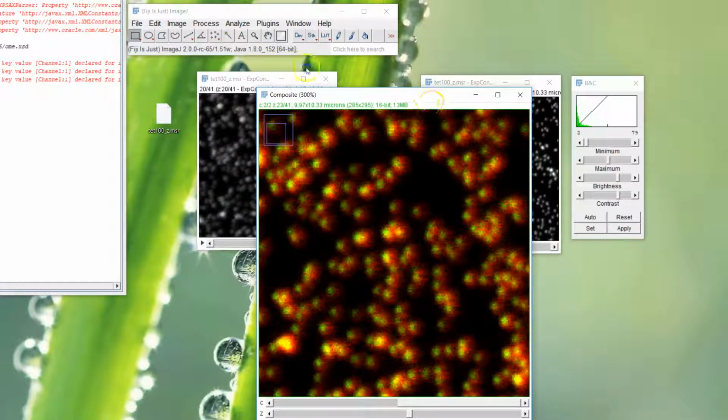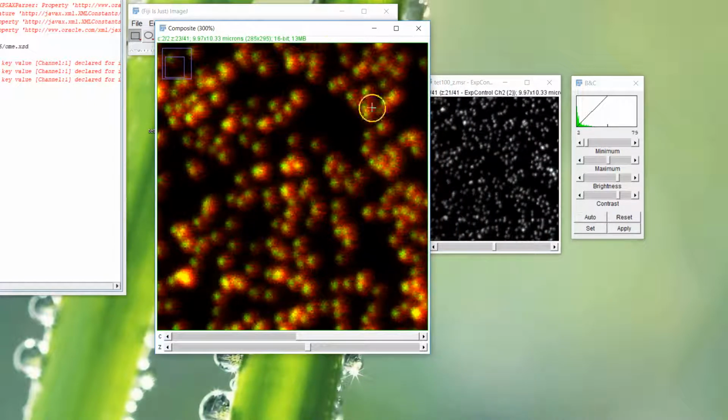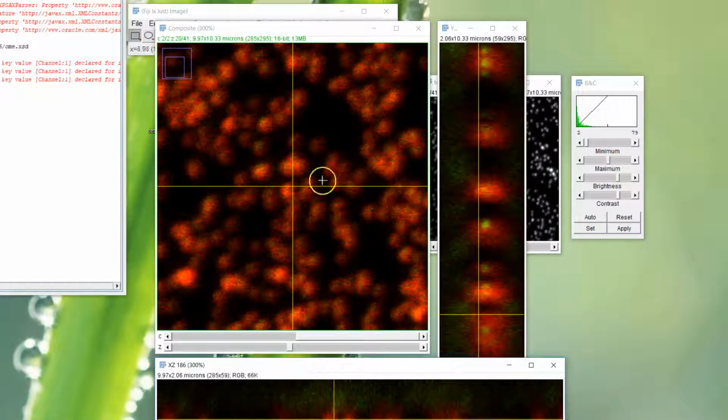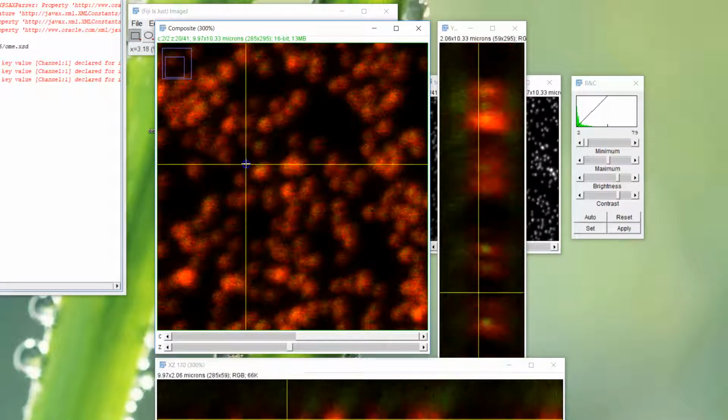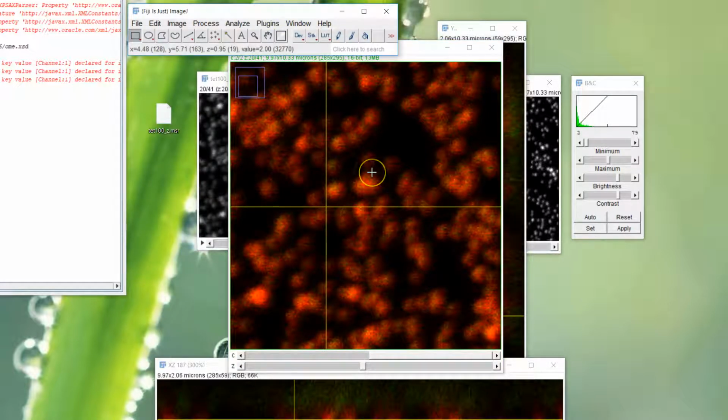And so that's it. That's how you do an overlay in Fiji. You can do Control-Shift-H to get the orthogonal views as well, if you need to do that too, to get the side angles, things like that. And give me a shout if you need to do more.